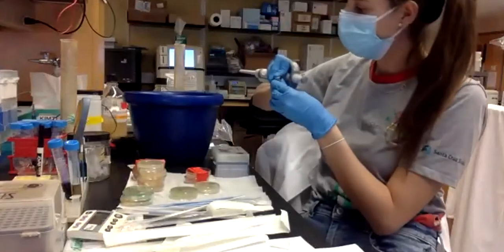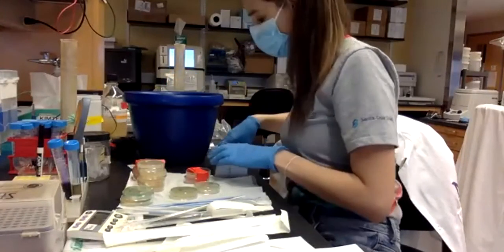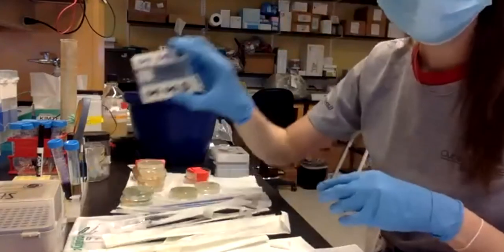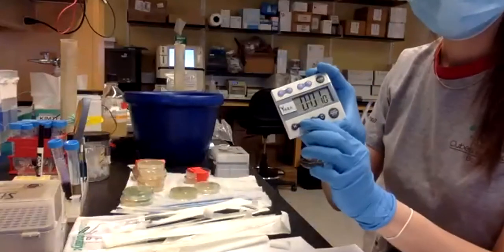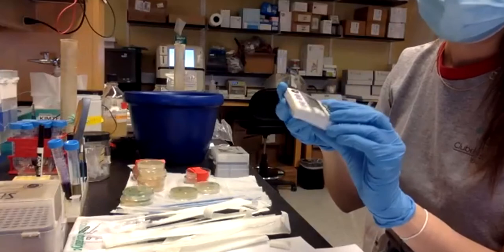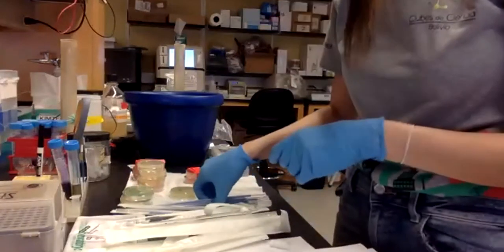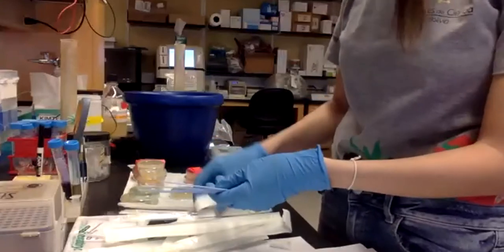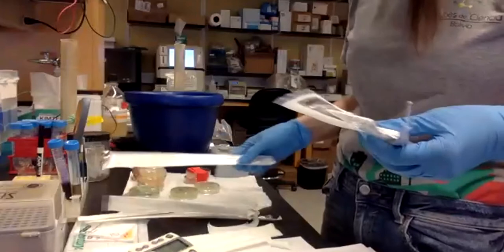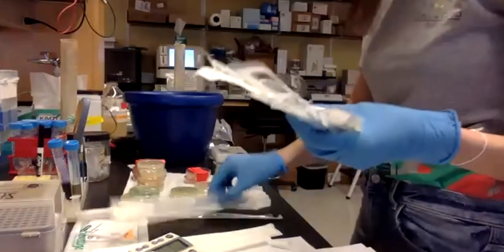Remember that here we are making the bacteria competent. So we'll leave it on ice. We'll put the timer for 10 minutes. And yeah, so I'm going to throw this. We'll wait for 10 minutes and then we will do the transformation.